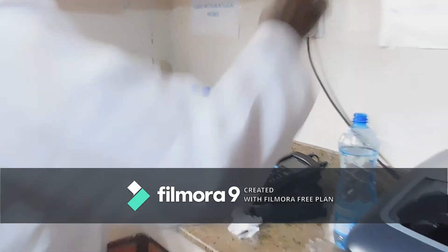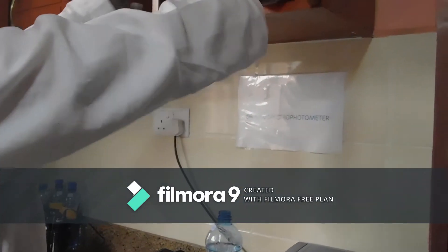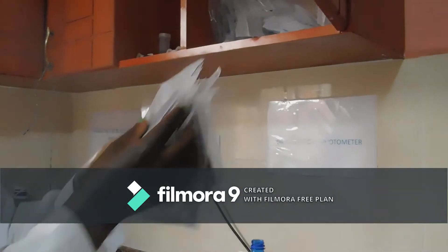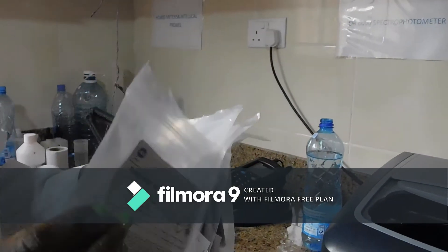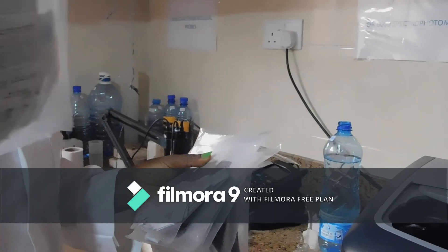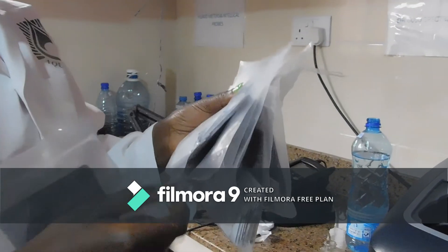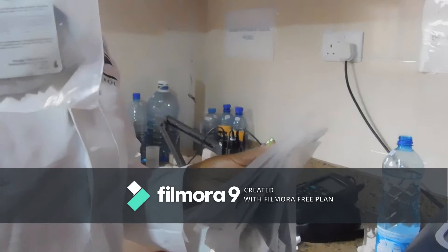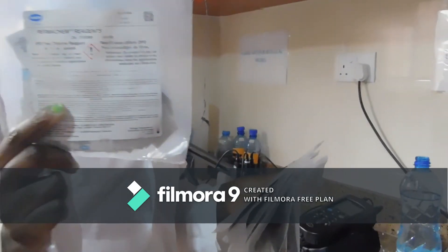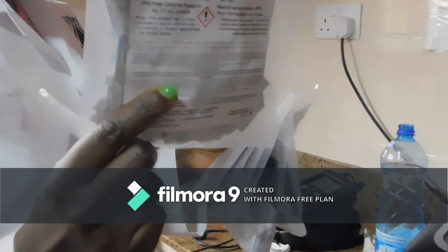For example, if you are analyzing phosphate or iron, you use different reagents. For iron, you use FerroVer. For phosphate, you use PhosVer. And for chlorine, you use the DPD chlorine reagent.